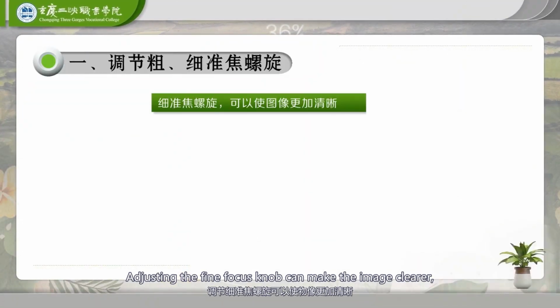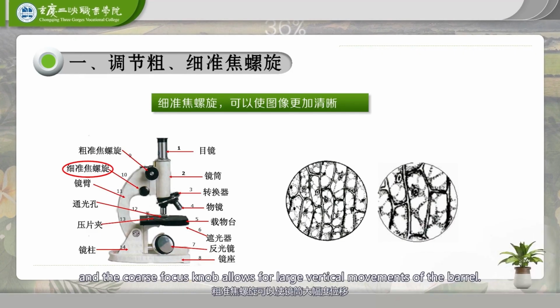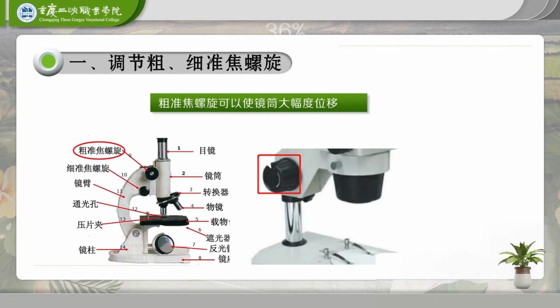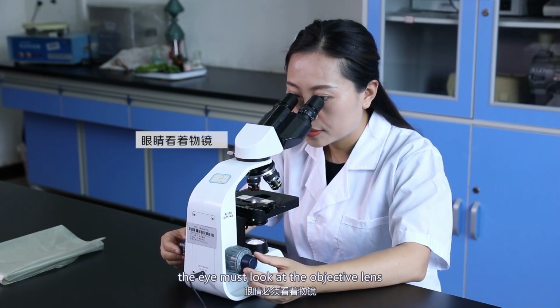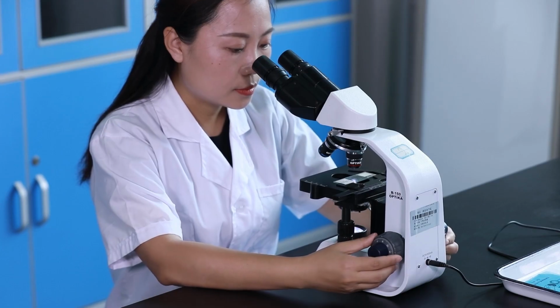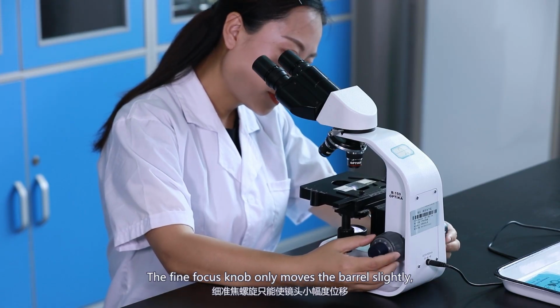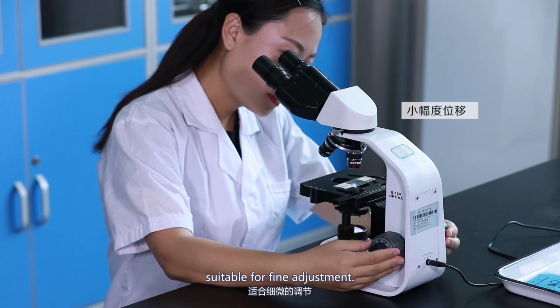Adjusting the fine focus knob can make the image clearer, and the coarse focus knob allows for large vertical movements of the barrel. Therefore, when adjusting the coarse focus spiral, the eye must look at the objective lens to avoid excessive displacement and the lens crushing the glass. The fine focus knob only moves the barrel slightly, suitable for fine adjustment.